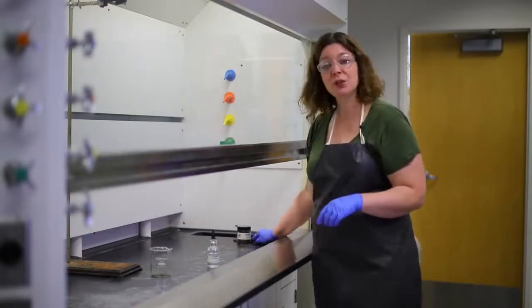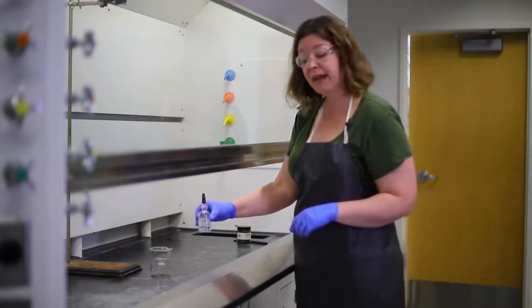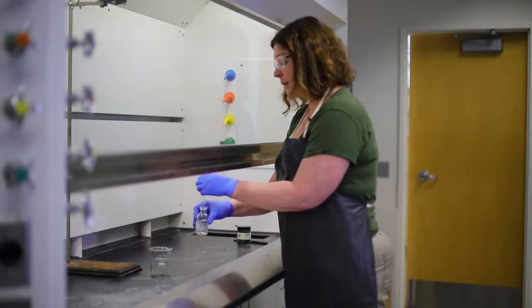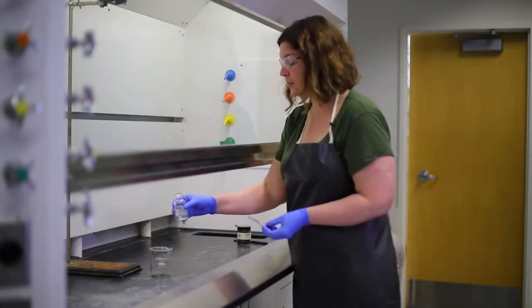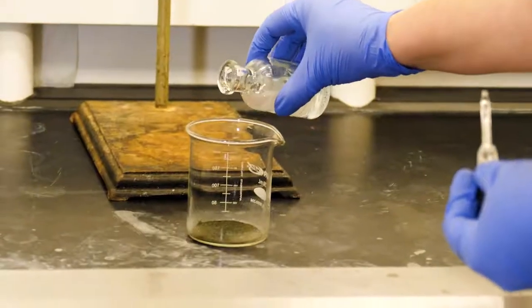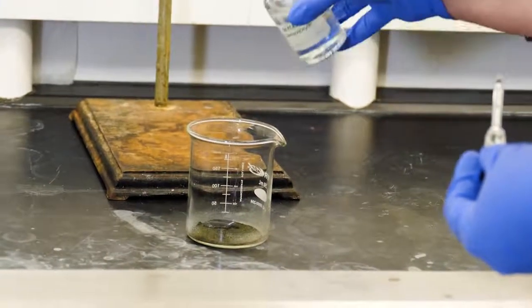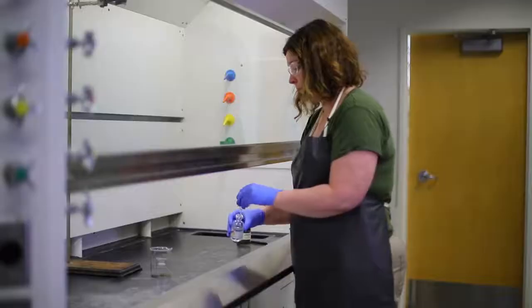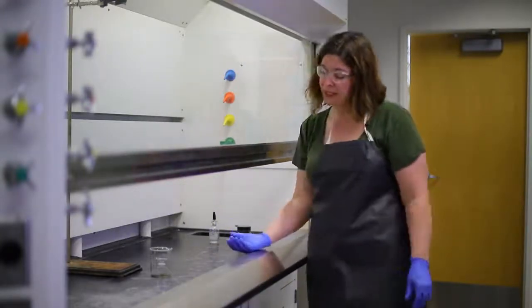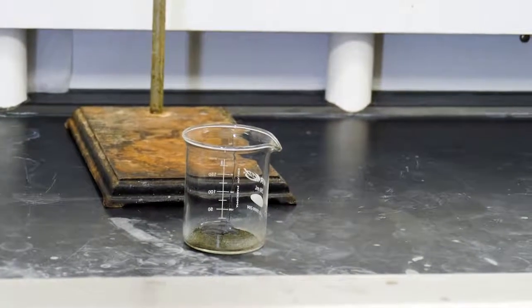Some fancy soaps are glycerin soaps. It's a component of triglycerides, of fatty acids that are found in animal fat. And it's going to be our carbon source in this experiment. All I'm going to do is mix a little bit of glycerin with our potassium permanganate. And when we let these two sit and react for a couple of minutes, they are going to spontaneously catch fire.